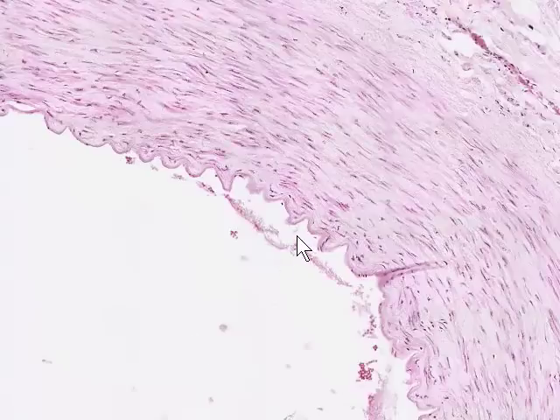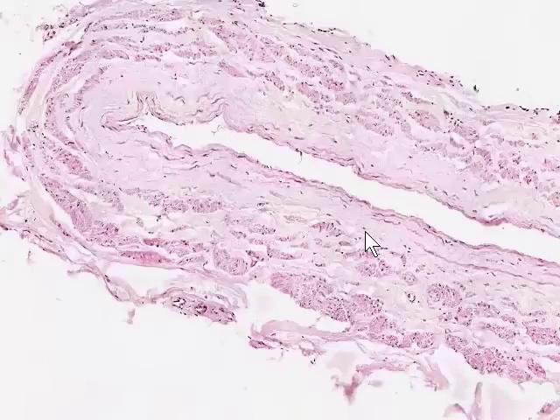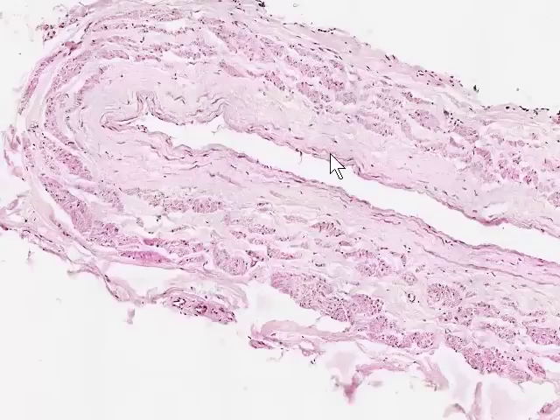Next we'll look at the equivalent vein, which is on the same slide. Here's the accompanying vein. Here's the lumen. The vein has collapsed down on itself, and this is because the thickness of the wall is small relative to the lumen size, and so it's not a very stable structure unless it's filled with blood. The endothelial layer, which lines and is the inner surface of the tunica intima, is along here, and we can see endothelial cell nuclei abutting on the lumen.